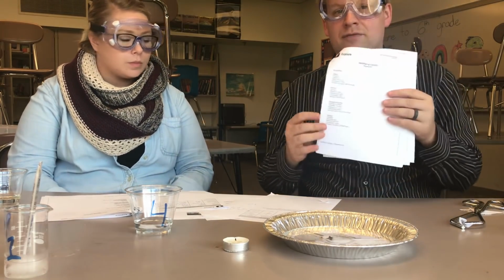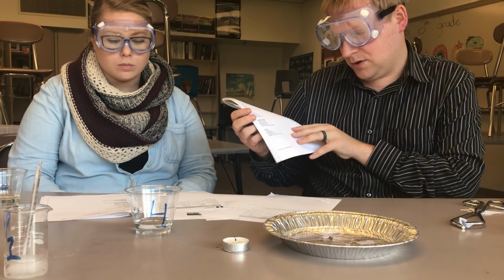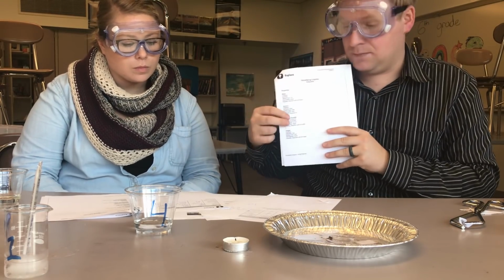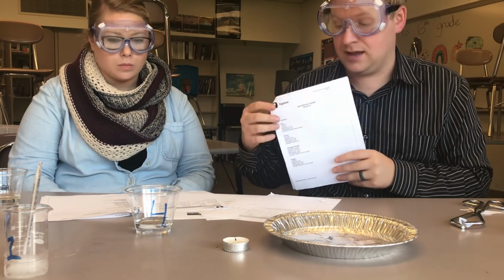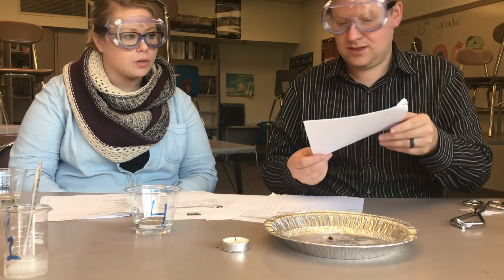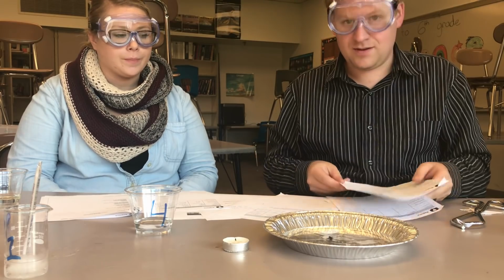Yeah, and you'll have a reference sheet that talks about our 4 liquids, and some of their properties, such as their odor, is it flammable, is it soluble, and you'll compare it to the data table that we've made, and you'll do your best to go back and answer our original question. And solve the mystery of what are those 4 liquids, and can you identify what 4 clear liquids are? Good luck.